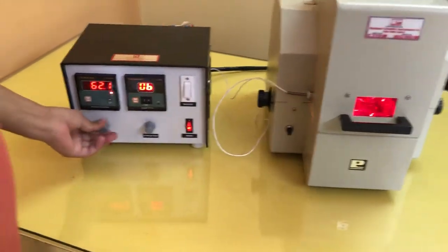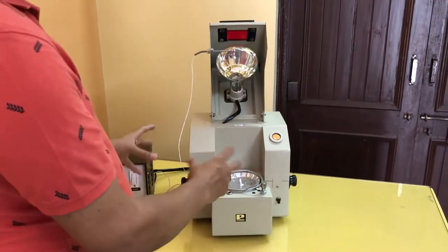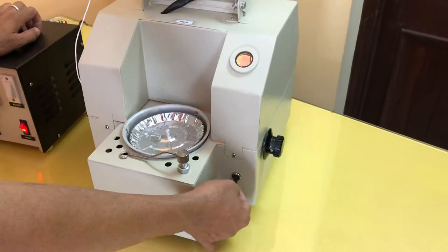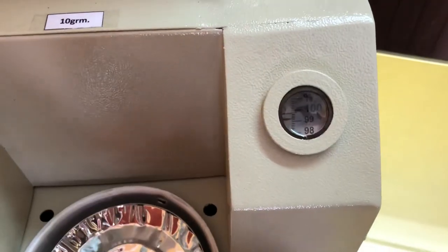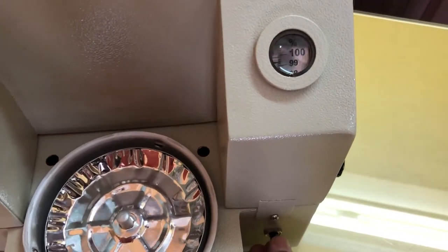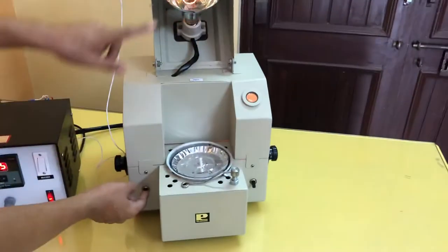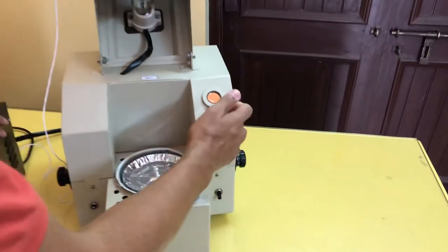Now I will show the working of this main instrument. As you can see, this is an analog instrument — some pointer, knobs and all these things are there. This is just a control unit to make the system automated. To operate this instrument, the main parts are: this is the scale dial bulb switch. If I keep it off, there is no light inside the scale — this is the scale viewing glass. As I turn it on, light glows. And this another switch is the main switch for the bulb. Suppose the bulb is glowing — if I turn it off, then no light will come there. So it is the main switch for the bulb, and this is the dial bulb for viewing the scale.